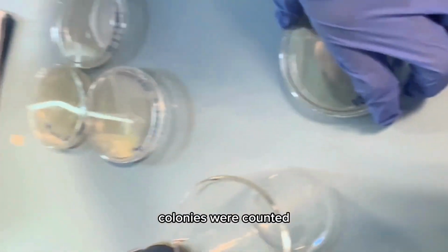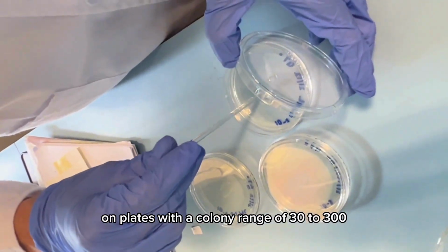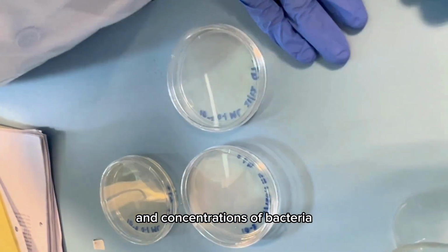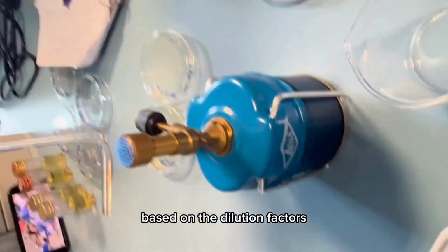Following incubation, colonies were counted, focusing on plates with a colony range of 30 to 300. Colony counts were recorded and concentrations of bacteria in the original sample were calculated based on the dilution factors.